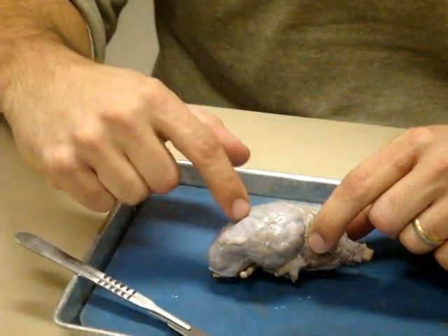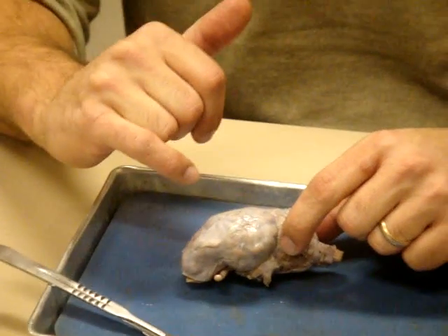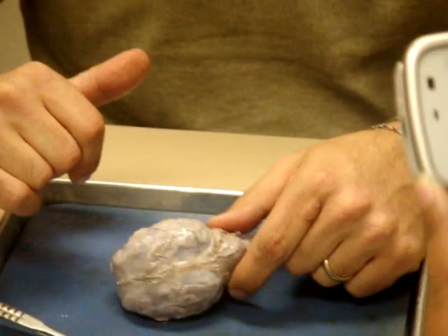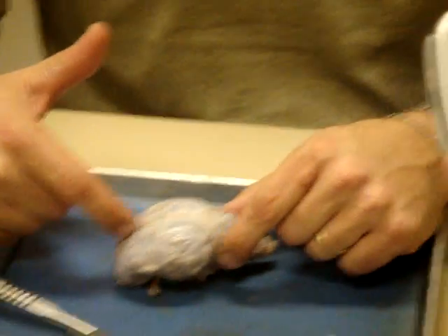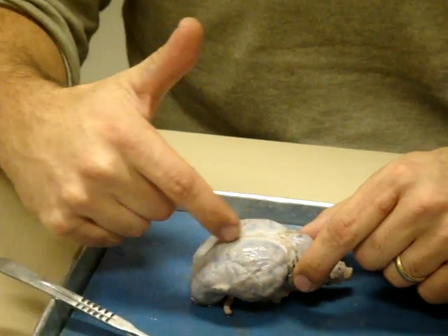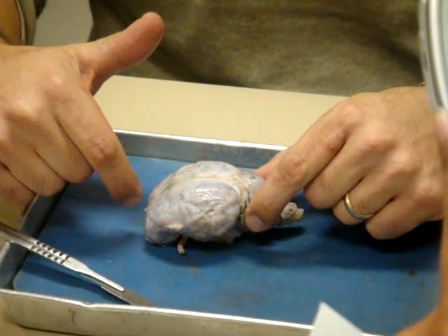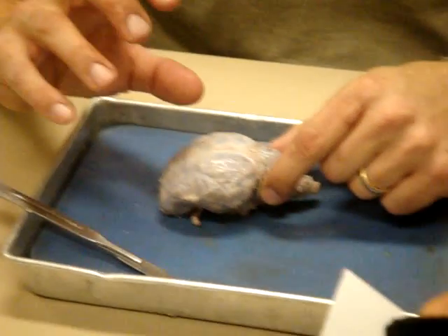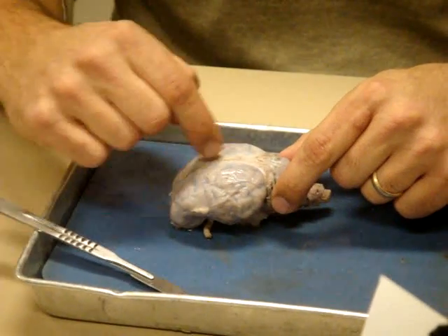You can kind of make out the gyri of the brain. And then the little darker grooves between them are the sulci, or sulcus. This area, you see the dura mater, it kind of gets thicker right here. That's going to be where our dural venous sinuses are located. What's inside the dural venous sinus? Blood. Okay. That's where the two layers of the dura separate into the periosteal and the meningeal layer. We have blood going through there.